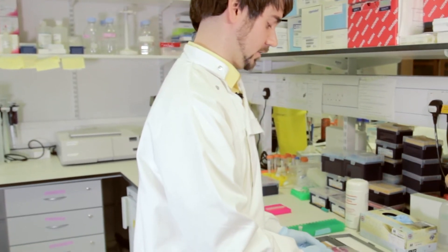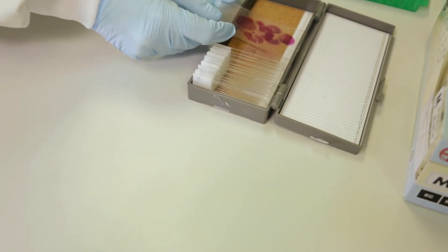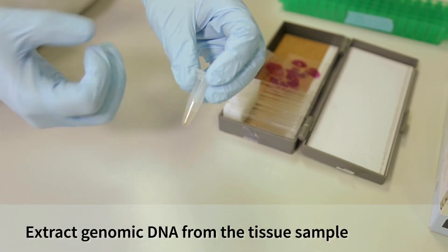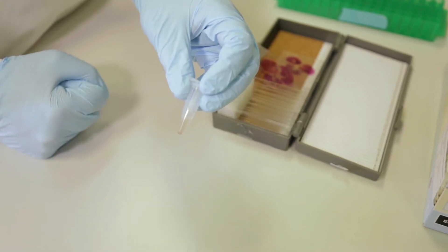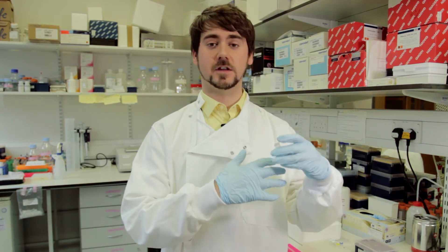Sanger sequencing is based on PCR, which is the first step of this procedure. But before we do that, let's talk about the DNA and where we acquire it from. This patient who had colorectal cancer has slides sectioned by pathologists, but we also have frozen tissue available. It's this frozen tissue that we can use to extract the DNA and then perform the sequencing on the region of interest. From this patient's genomic DNA we can now perform the PCR reaction.